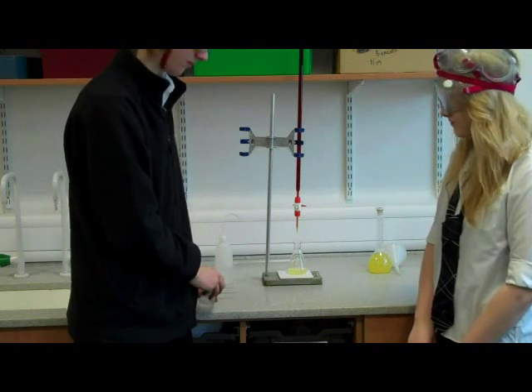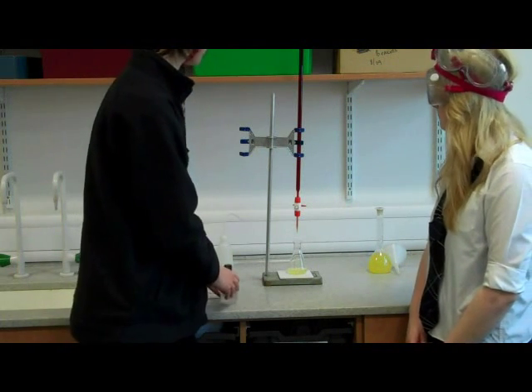Step 5. Take reading of first iodine level from the top of the meniscus.